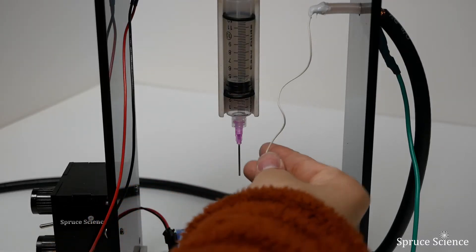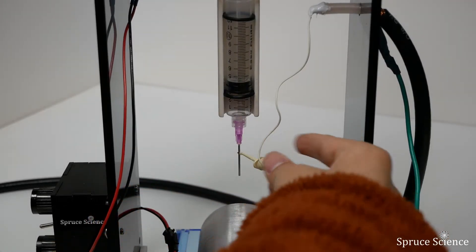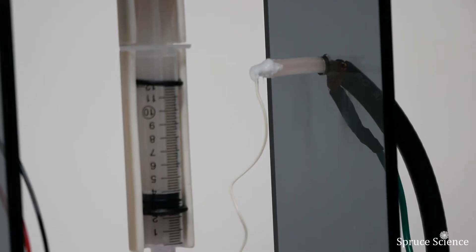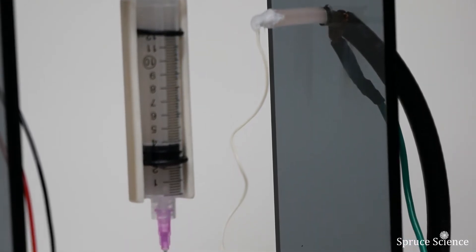Connect the high voltage clip to needle. Make sure the high voltage power supply is off before touching the clip.